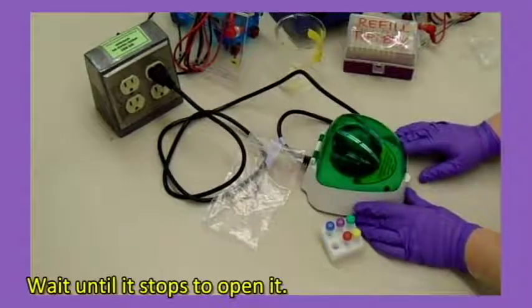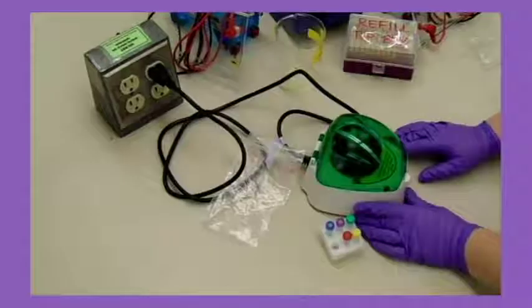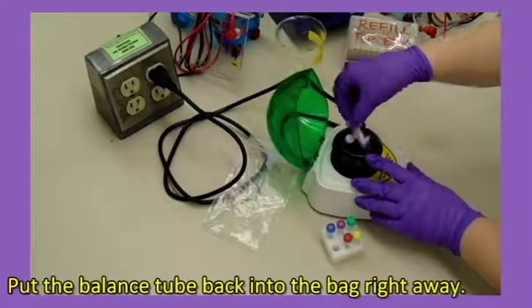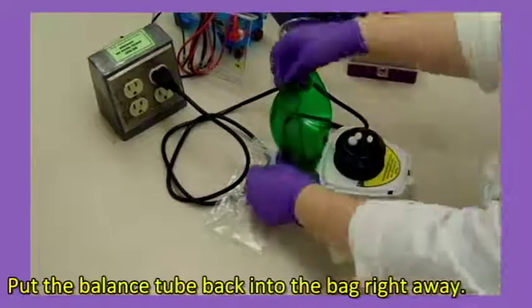Wait until it stops to open it. Put the balance tube back into the bag right away.